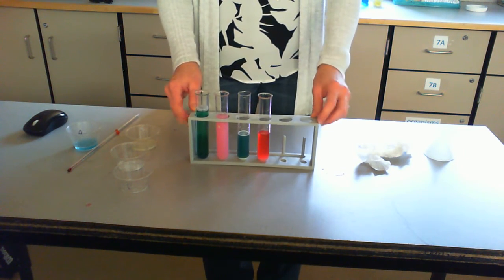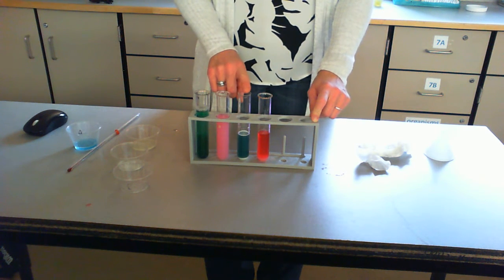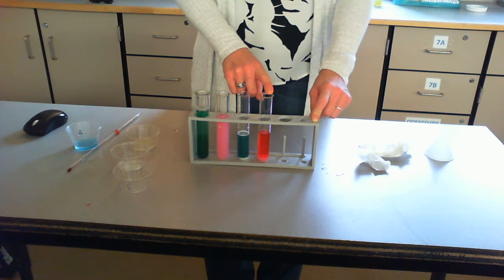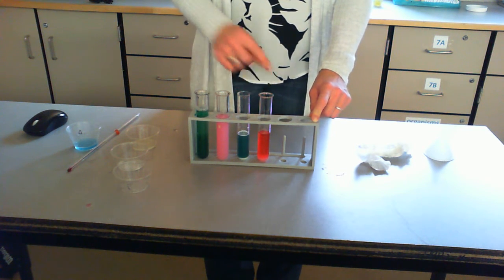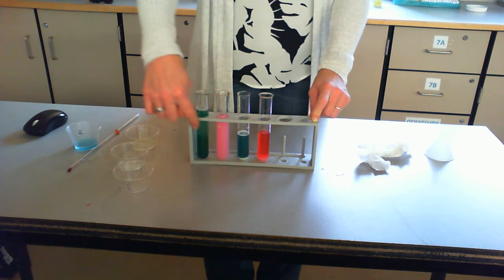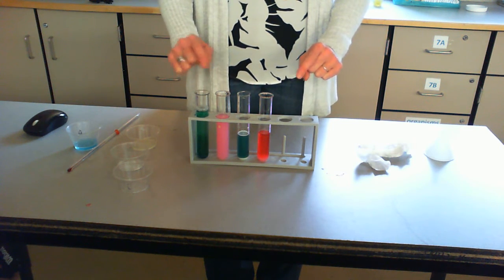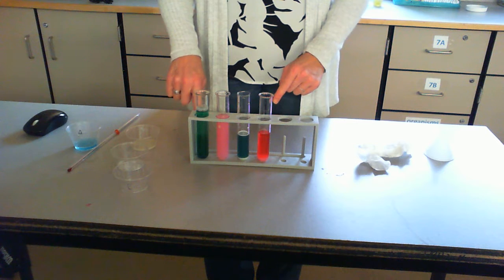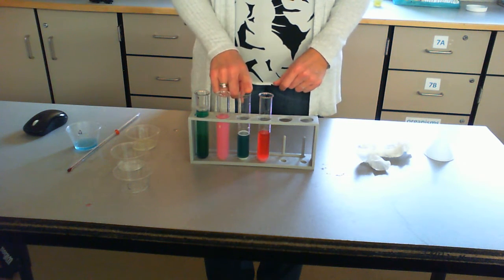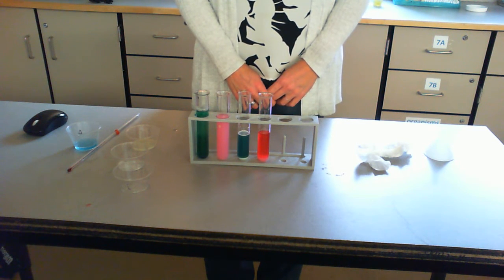So here are our mixtures: my window cleaner mixture, my lemon juice mixture, my sodium carbonate mixture, and my citric acid mixture. For the last part of this activity, you're going to compare the colors of these to a pH chart. You might want to pause the video at this point so that you have the colors in front of you. Remember it's window cleaner, lemon juice, sodium carbonate, and citric acid — and then you should be able to finish the rest of the activity.